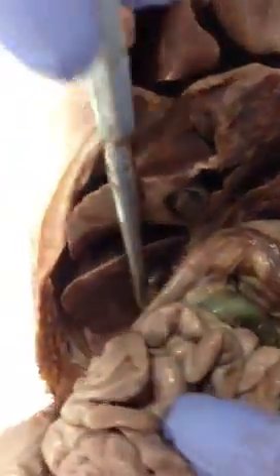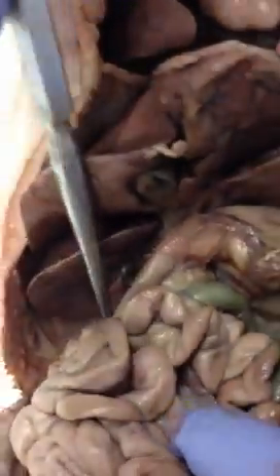This is the stomach. Coming out of the stomach, this hard area feeds into the duodenum, which feeds into the jejunoileum, or small intestine — and that's all of this.